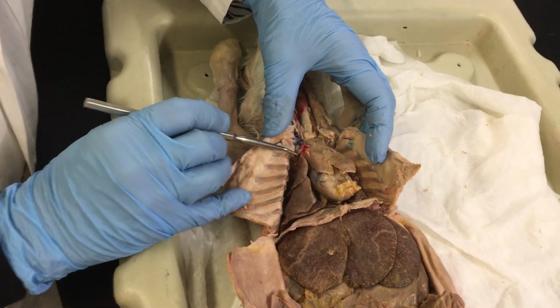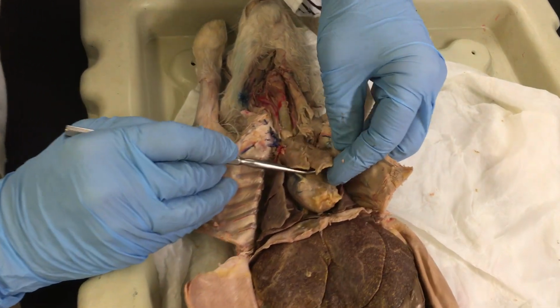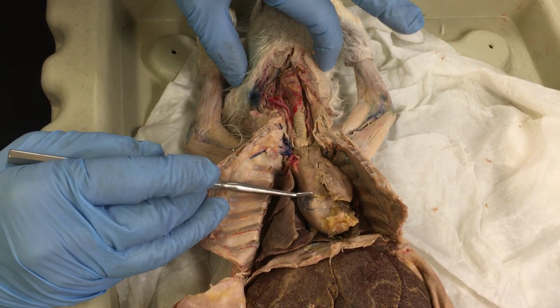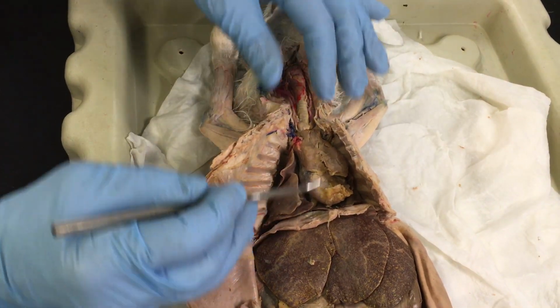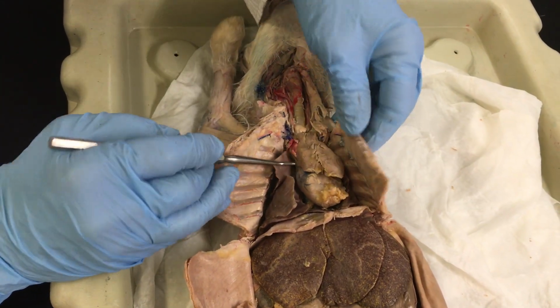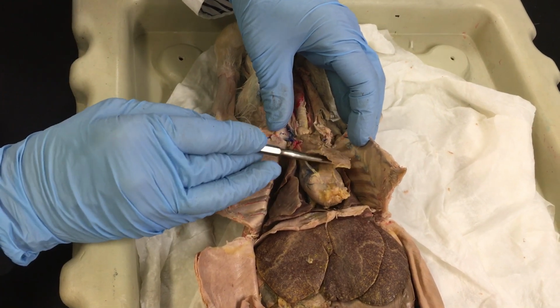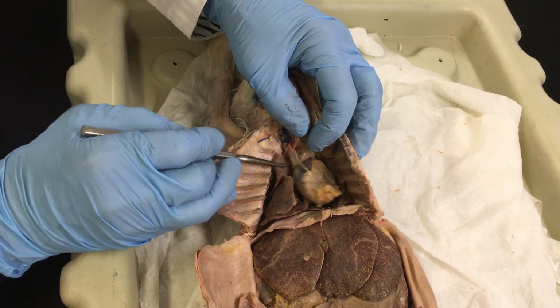Going back to the thoracic cavity, there are some other structures that you need to know. One of them is very noticeable: this is a gland, actually the thymus gland, with these lobes. It is very large, and usually this gland is very prominent in a young specimen, and the same happens with humans. The function of this gland is to start to set up the immune system, which is why it's so prominent when they're still young, and then eventually recedes once the immune system is already set up and going.